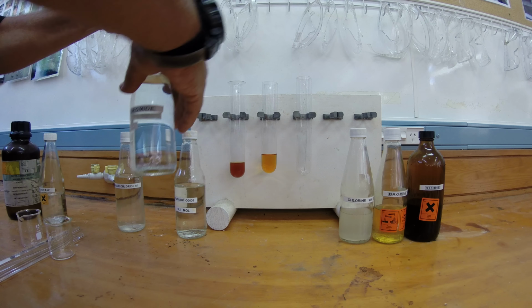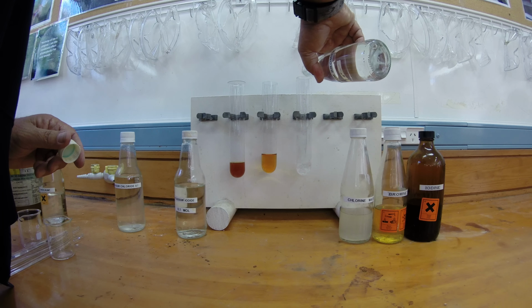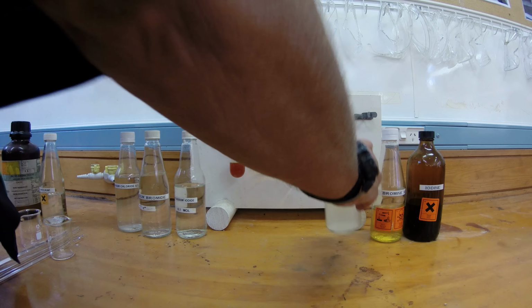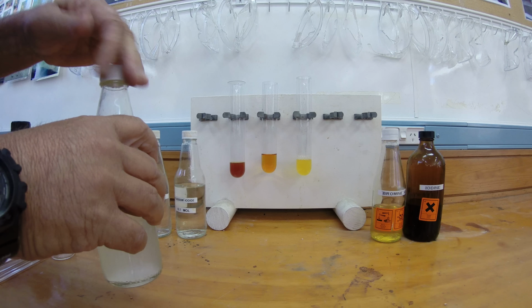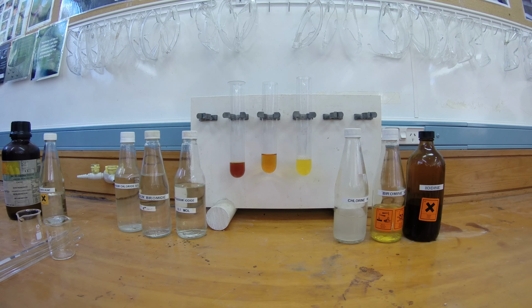Another one we're going to do is to put potassium bromide in this test tube, which has no colour, and react it with chlorine water. So those are the 3 that you should have got results for, changes. In all 3 we're getting some sort of colour produced there, or a darker colour anyway. Is everyone okay with that?